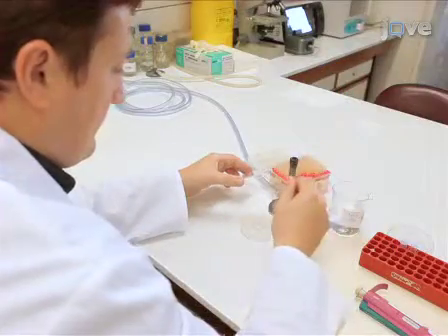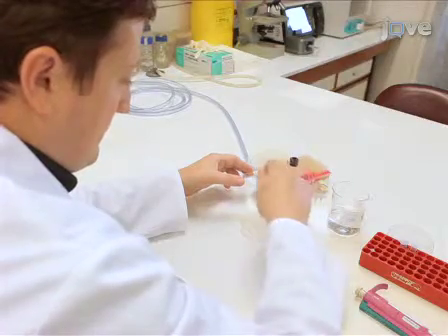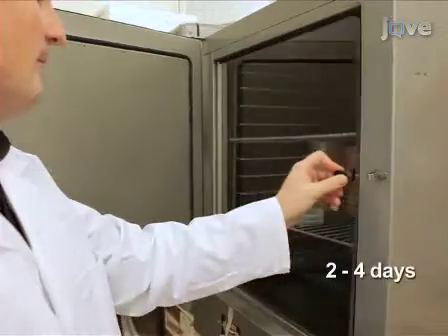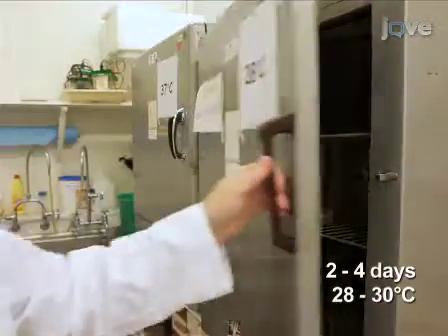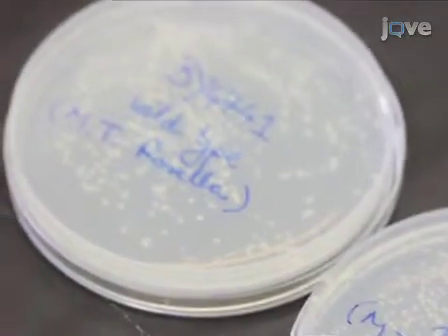Standard procedures are used to transform the yeast strains with a plasmid carrying the mitochondrially targeted Rosella reporter. Growth plates are incubated for 2 to 4 days at 28 to 30 degrees Celsius until the appearance of colonies about 2 to 3 millimeters in diameter.